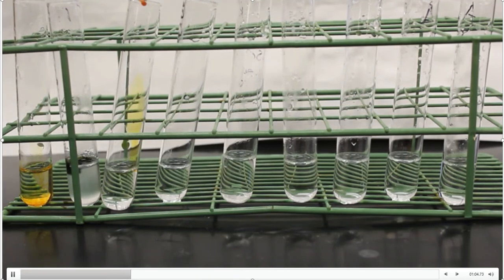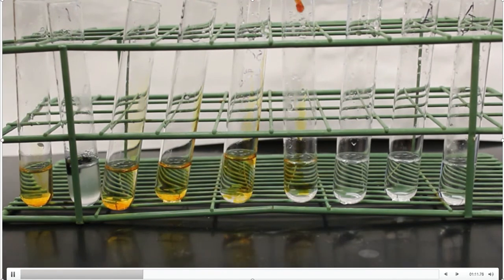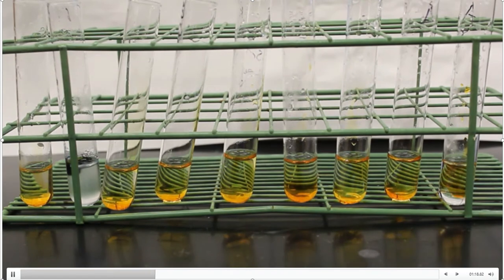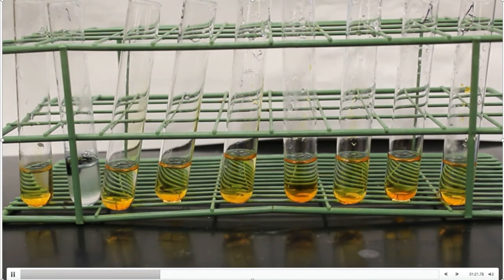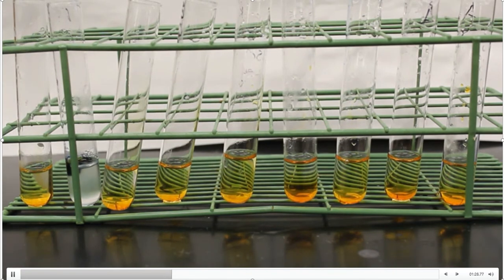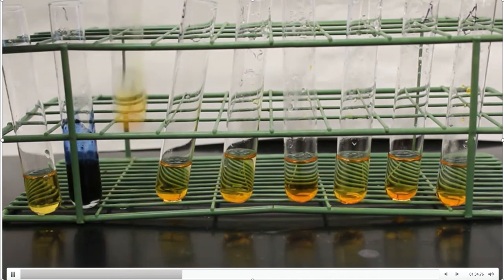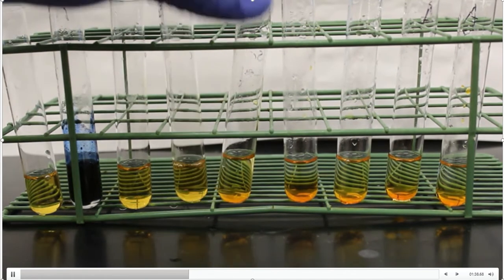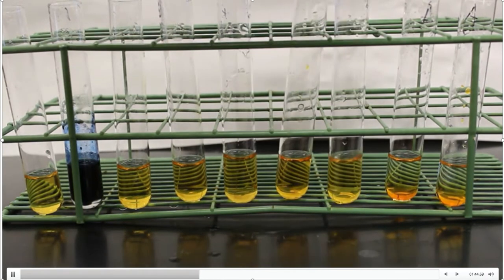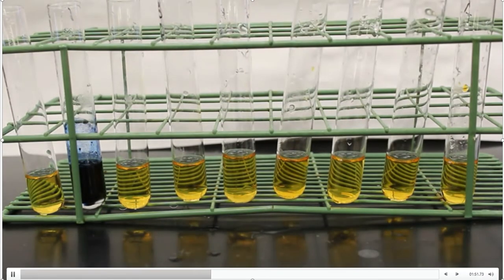A couple of drops goes into each one, and then I'll give it a good mix at the very end and we'll take a look at our observations. At that point I'll go through and tell you the IDs of these sugar solutions — which ones are the unknowns and so forth. So there is the addition of the I2KI solution. I think you already know kind of what to expect. I'm going to give these a pretty good shake just to make sure the reagent is completely mixed. The beauty of qualitative analysis is not measuring anything exactly — you just add it, mix it, and write down your observations.